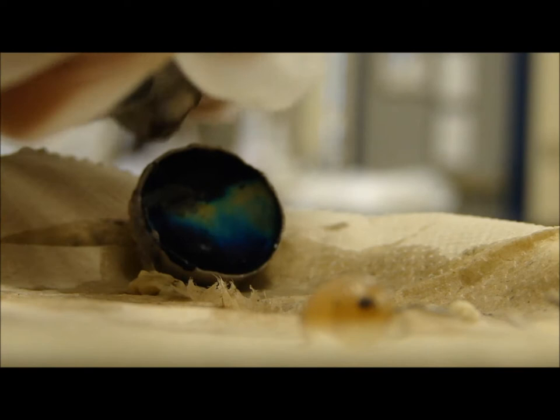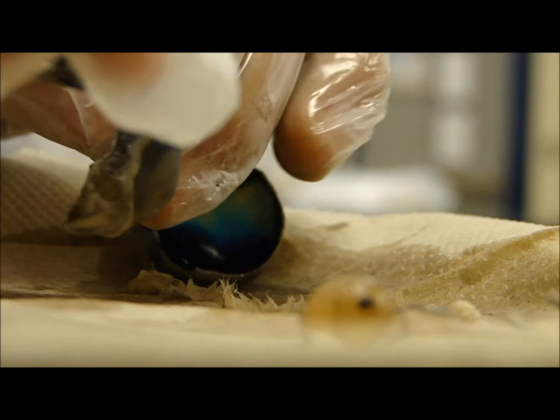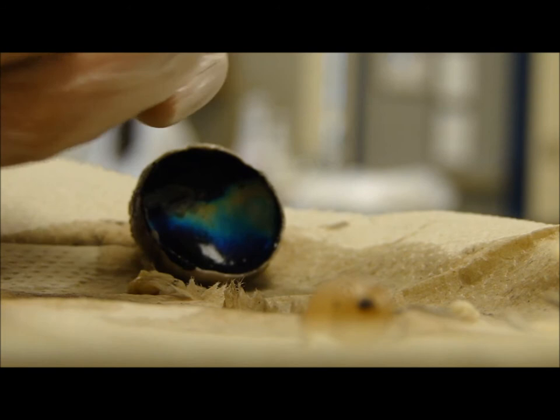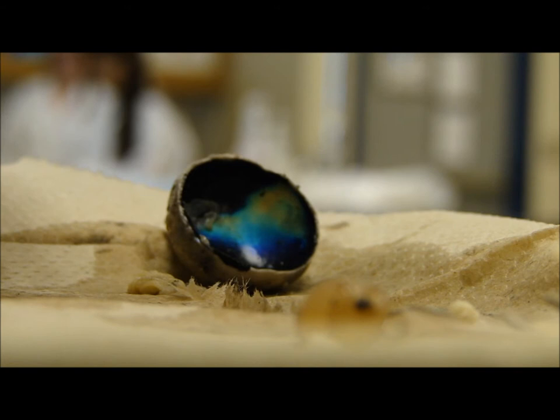Tell me if I'm focused. You're cutting the middle out. It's disgusting. It's like dark. Did you get it cut? Yes. You've cut cherry tomatoes before and they squirted all over you — they're the same thing. That's why I don't like eating tomatoes; it makes a mess whenever you're cutting them.